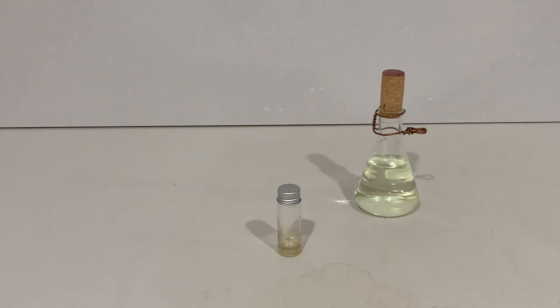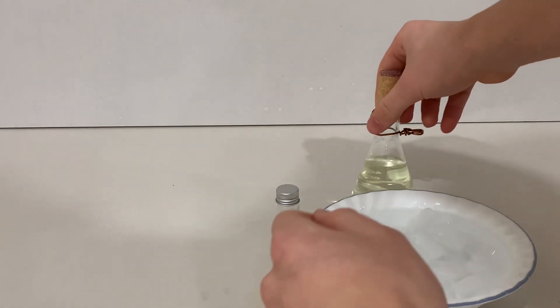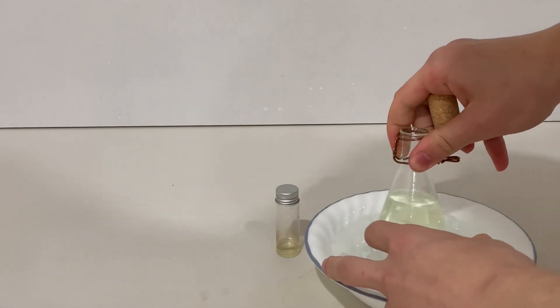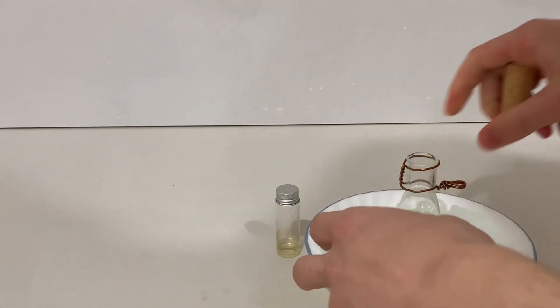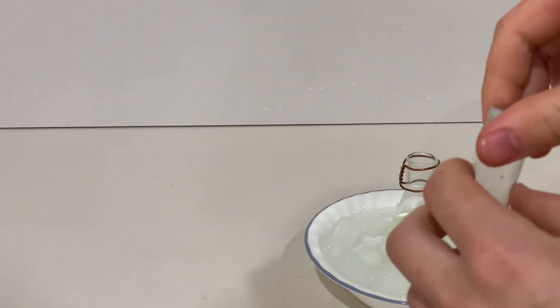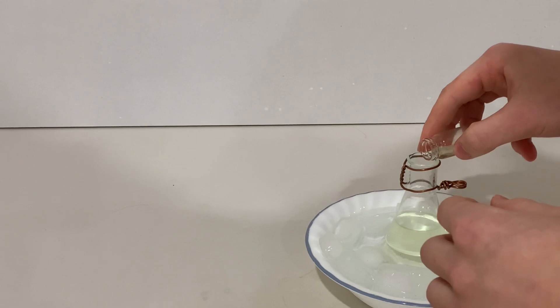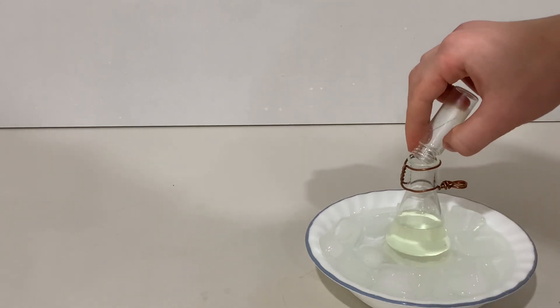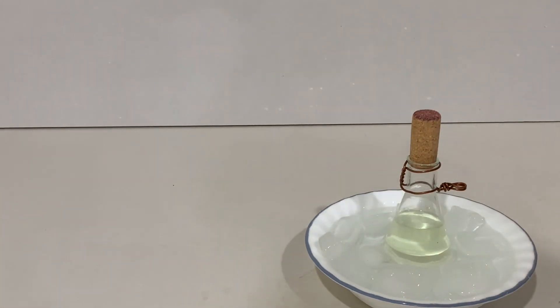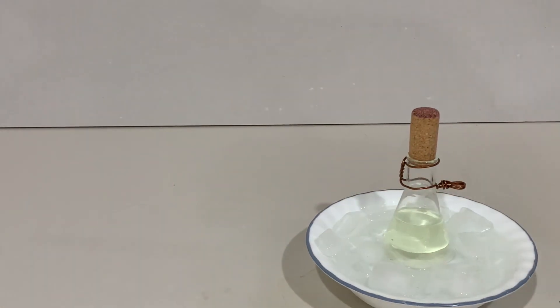The process is really quite simple. I get this ice bath, put it on the table, get a bottle of bleach and open it. After sniffing chlorine this actually smells quite good. Then I get the acetone and try to make sure that all droplets on the sides did actually mix with it. And that's literally it — just mix it around a bit more and leave it like this for an hour.